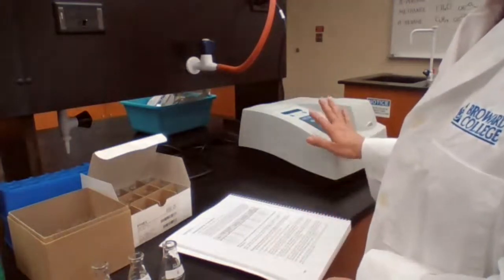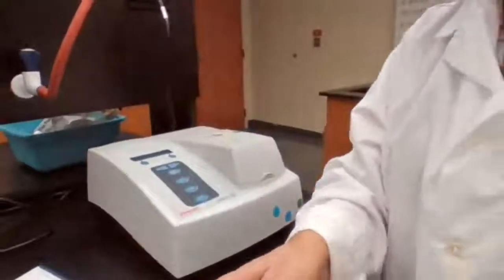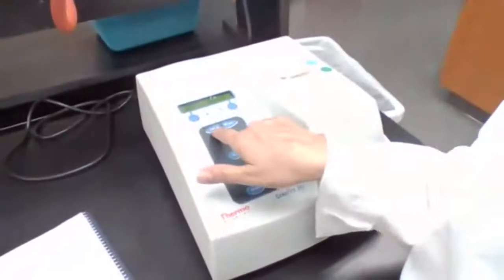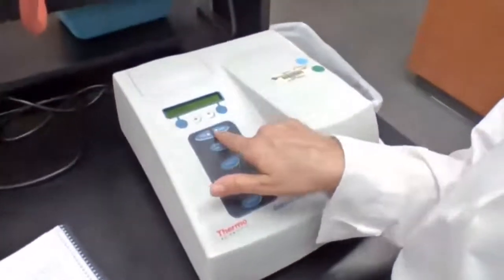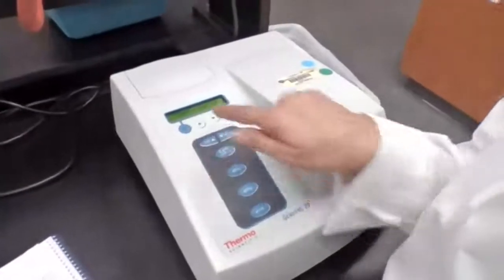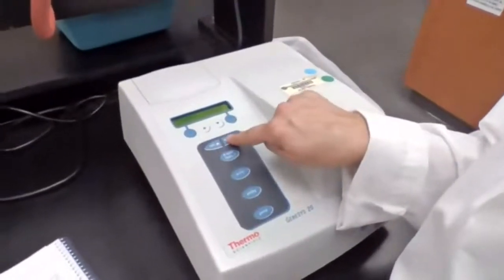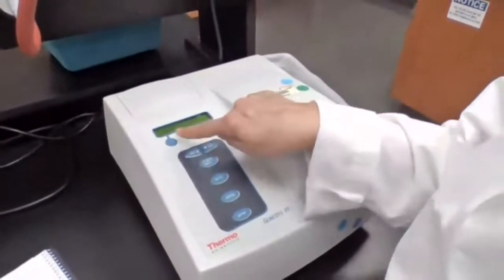The instrument is on already. The wavelength, I set it up. I'm going to show you because it tells you in the procedure, so I want you to know what is done and how this part of the experiment is going to be performed. We can change the nanometers, we can increase or decrease, and it's saying to set it at 480. I just set it at 480, but I'm showing how to go up and down here to make it 480.